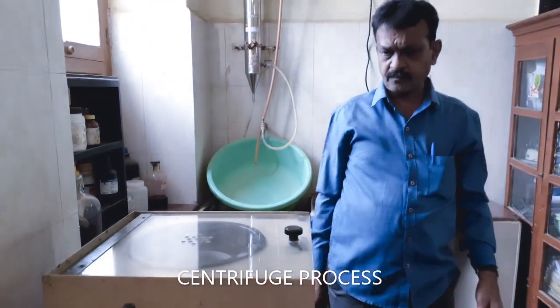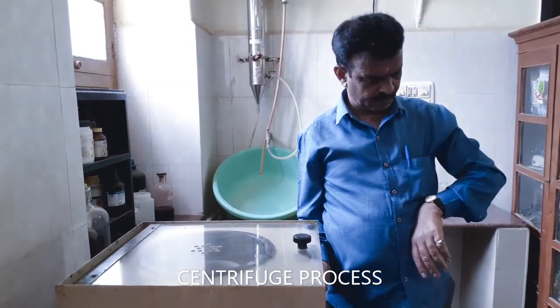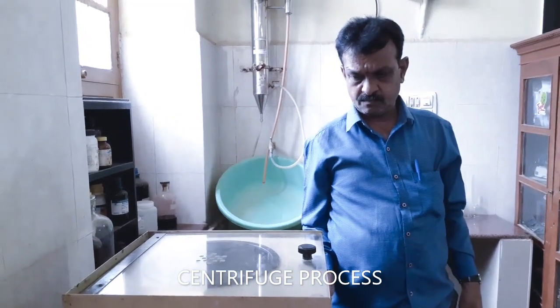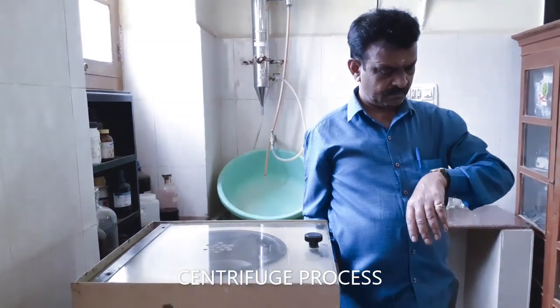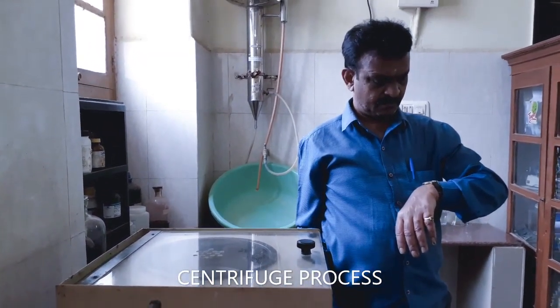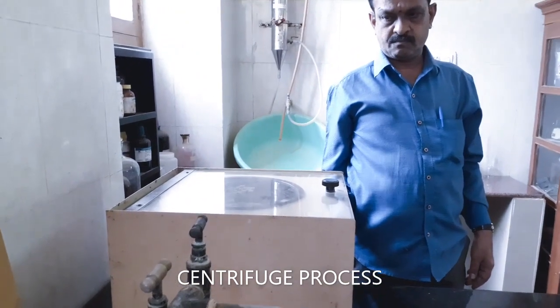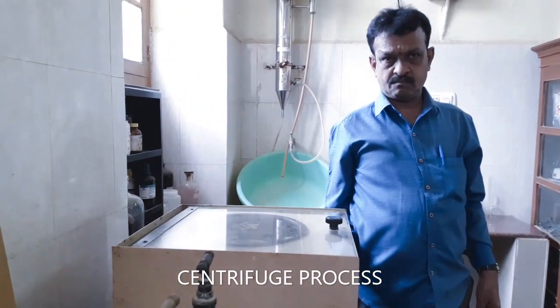We have to centrifuge for about 10 to 20 seconds, maximum 30 seconds. Within the time, the precipitate will settle at the bottom, that is called residue, and the clear solution will settle at the top, that is called centrifugate. That centrifugate contains another basic radical in the form of ions. The residue is aluminum hydroxide, which is formed from aluminum ion basic radical.